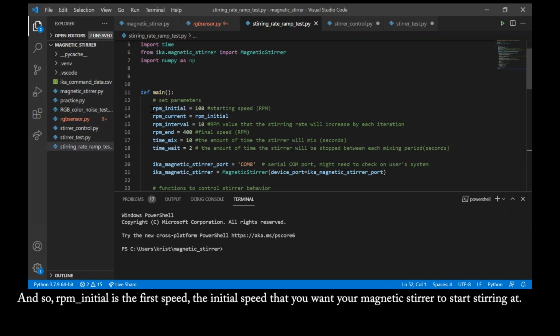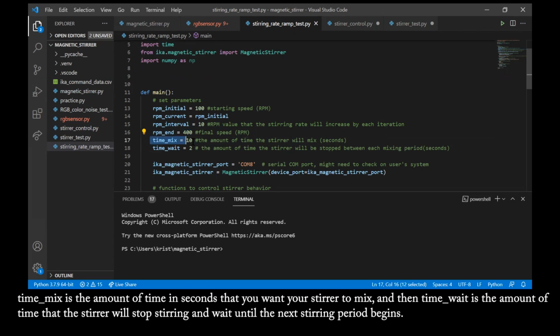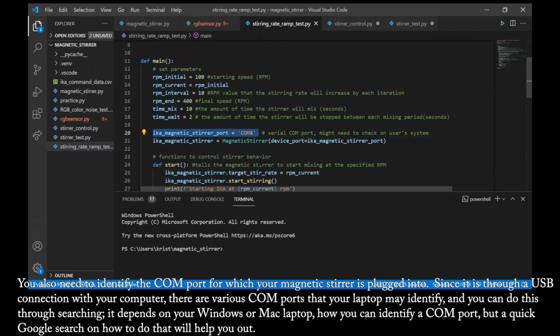RPM initial is the initial speed that you want your magnetic stir to start stirring at. RPM interval is the amount that you want your stir to increase through every time period. And RPM end is the final speed that you eventually want your stir to increase to. Time mix is the amount of time in seconds that you want your stir to mix. And then time wait is the amount of time that the stir will stop stirring and wait until the next stirring period begins. You also need to identify the COM port that your magnetic stir is plugged into.